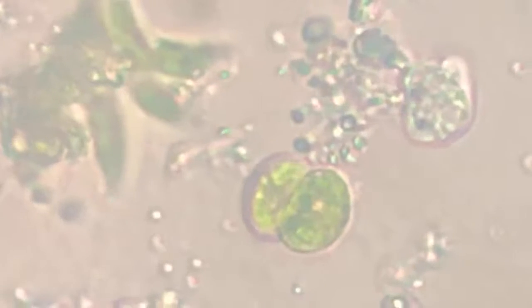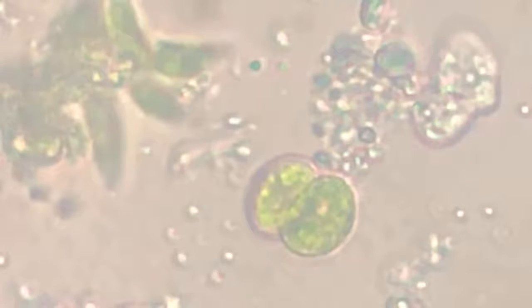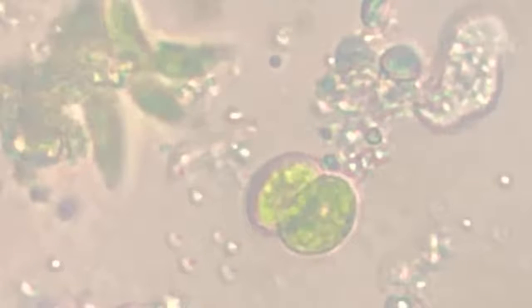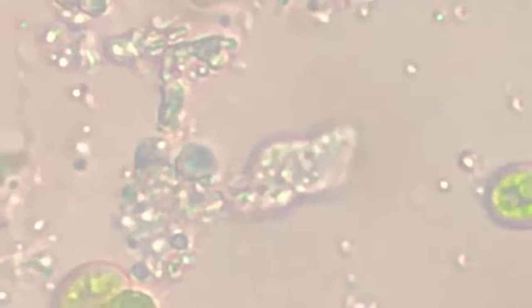Numerous bacteria, few algae, a little bit of debris, and one creepy crawly amoeba. Amoeba proteus. This is not Proteus, of course. Proteus is a larger amoeba. This is a normal amoeba. I don't know the species.